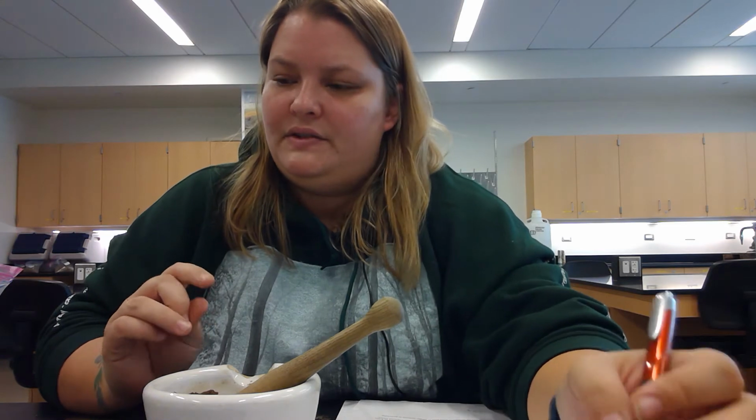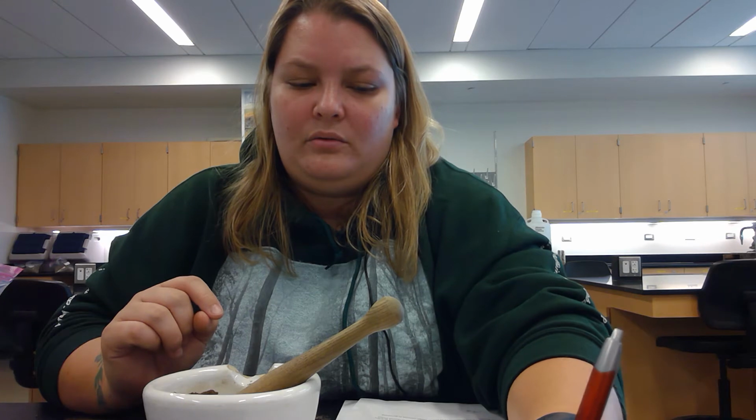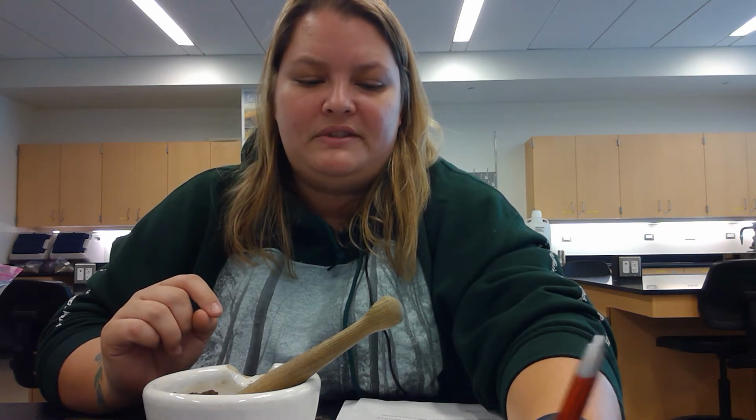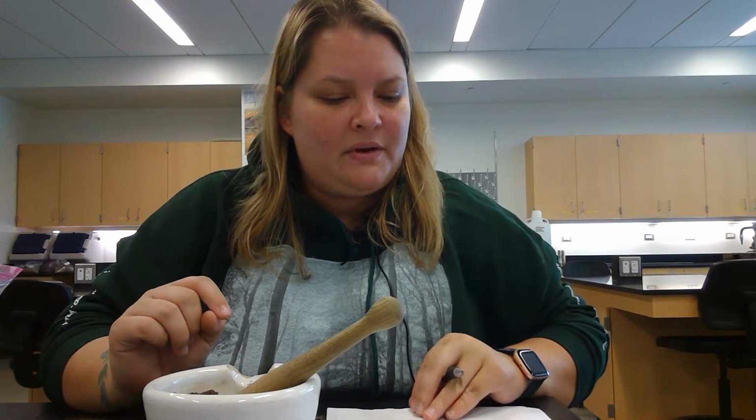All right, so this now weighs 123.14 grams.